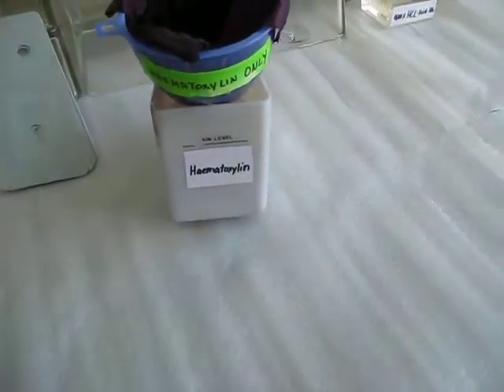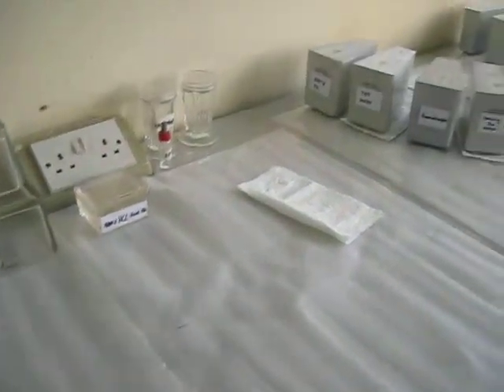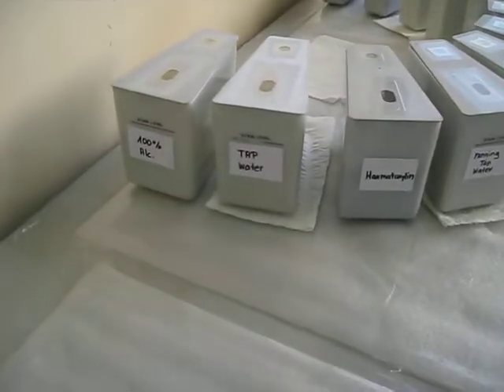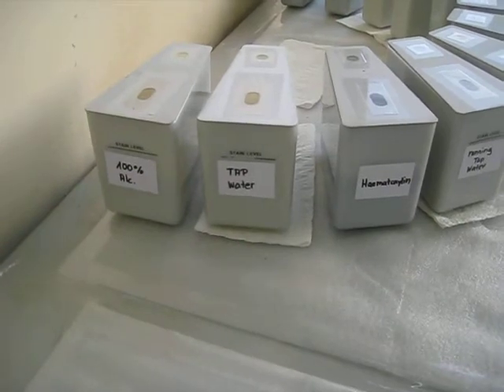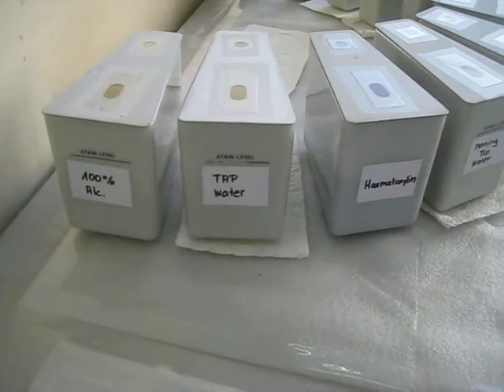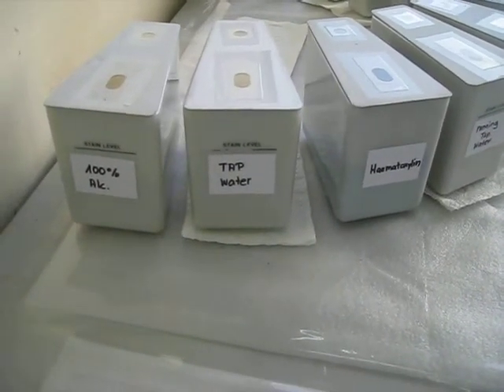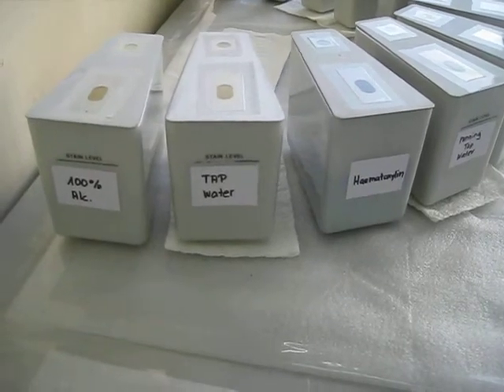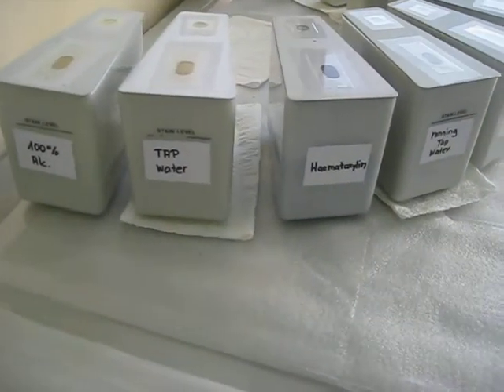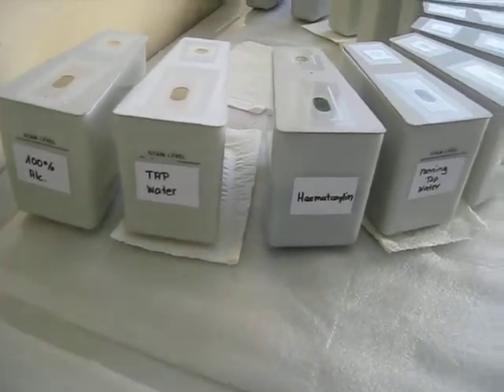By doing this every morning you ensure that you have a clean slide when you are reporting. The other thing you need is 100% alcohol, which serves to wash off some of the glycerin used in the alcohol sprays that fix the specimen. You keep it in alcohol for about 10 minutes, then you have tap water.